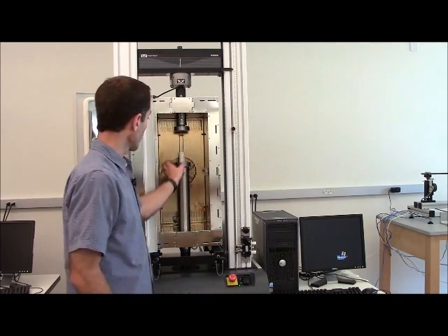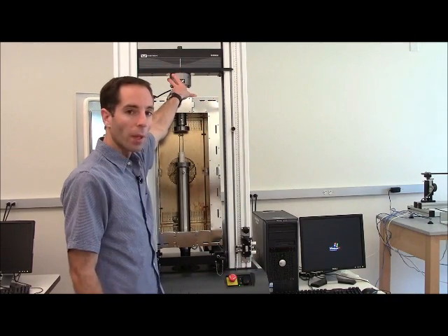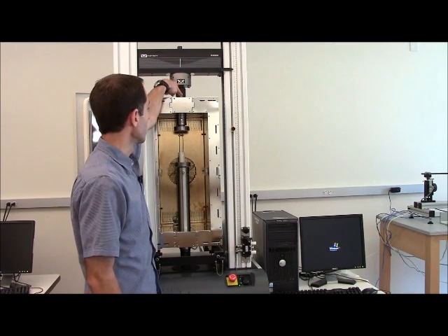Now even when that is up pretty close and just barely touching such that we can start to test to compress, we need to be very careful that up here on the top nothing hits the top of the oven. And again the first thing that's going to hit is that pin that might not be visible right now but that pin is going to hit as it comes down. So you've really got to watch that and make sure your clearances are enough.